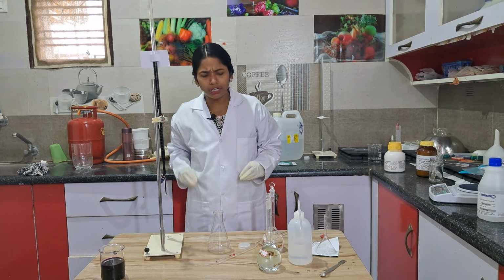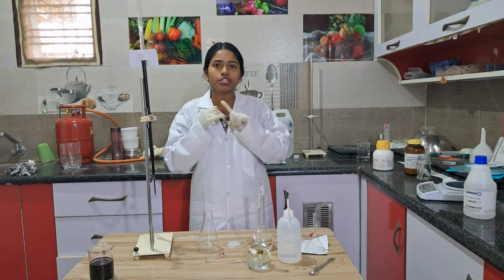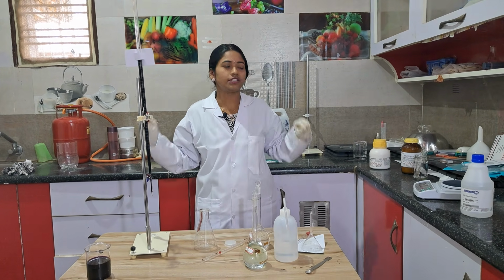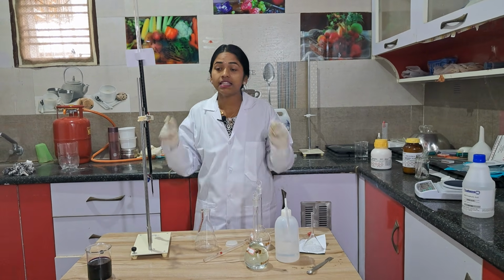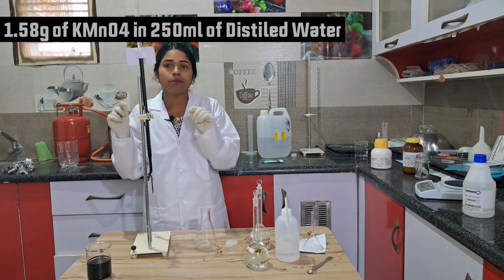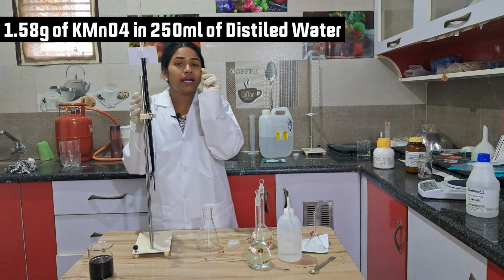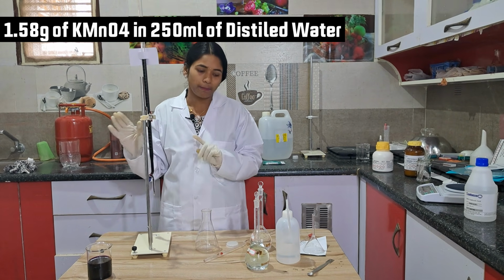If you are a student and you want to do it from scratch level, where your lab in charge and your teacher are not there and just reagents are there in the laboratory, and you want to prepare everything, then I am going to tell you how to prepare even KMnO4. I have prepared KMnO4 by taking 1.58 grams of KMnO4 in 250 ml of water.